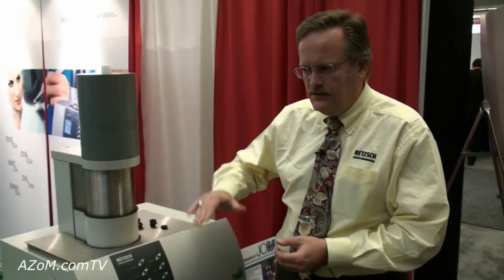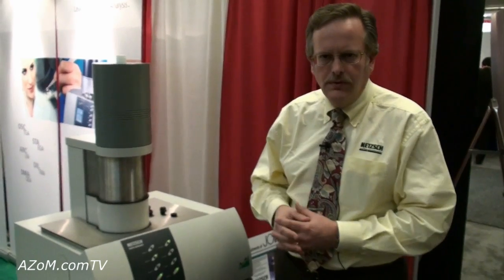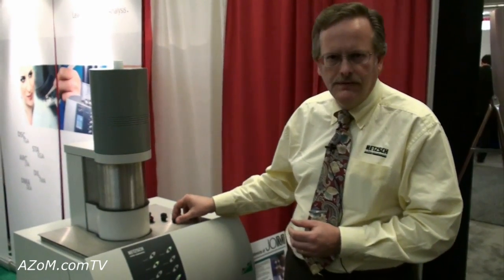Approximately how long does it take to take a measurement using one of these devices? The actual measurement time is just seconds. You might have a few minutes to come to equilibrium — maybe ten minutes or so to come to thermal equilibrium in the sample as you set the temperature inside the furnace. But the actual flash measurement itself is milliseconds. So it's a very fast technique, it's non-destructive, sample preparation is relatively easy, and you get a very nice representative sample to measure the thermal diffusivity.